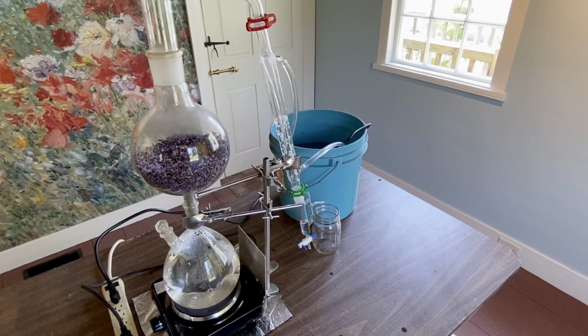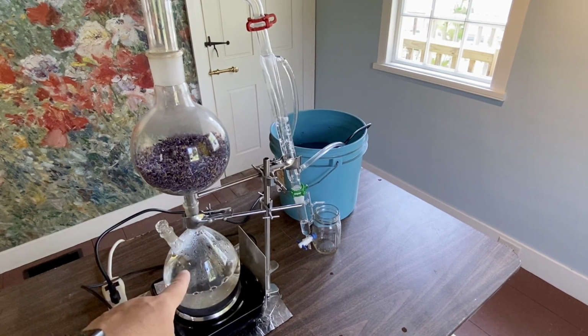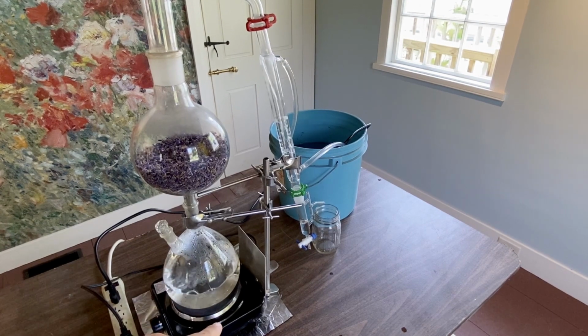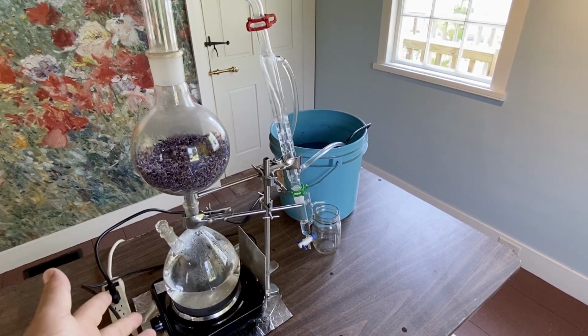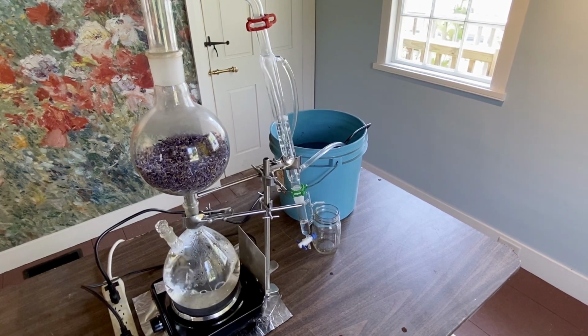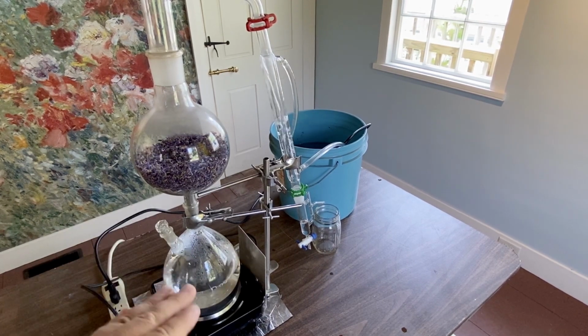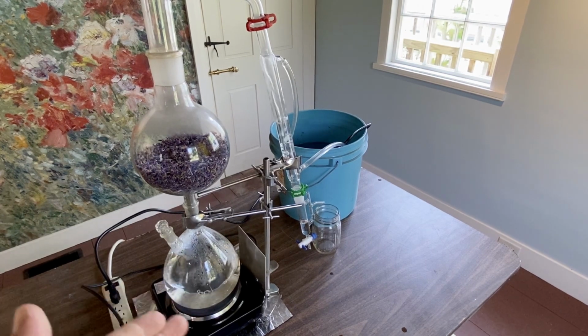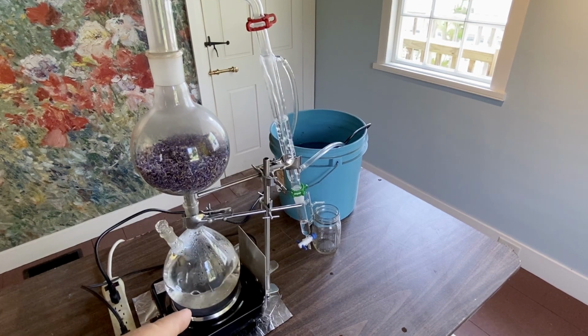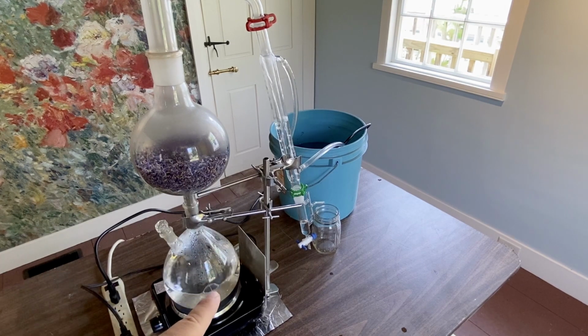All right, everyone. Now we've got a nice simmer, all right? Now the key to temperature with these types of hot plates, of course, it was certainly Bunsen burners or natural flame initially with distillation in early America. But eventually, yes, we started using these hot plates by the 20th century. Now, some of them allow you to have a digital screen to really play with those exact temperatures. But these inexpensive versions, you really have to kind of find that sweet spot. So again, you want to simmer.